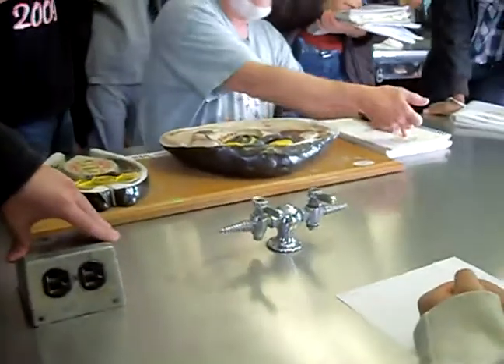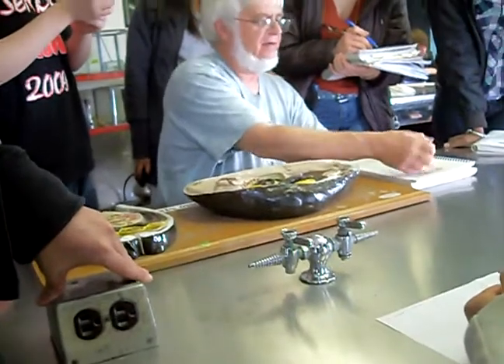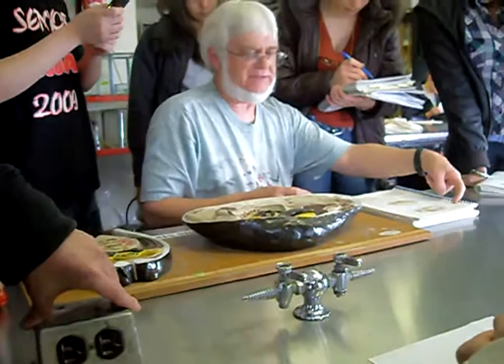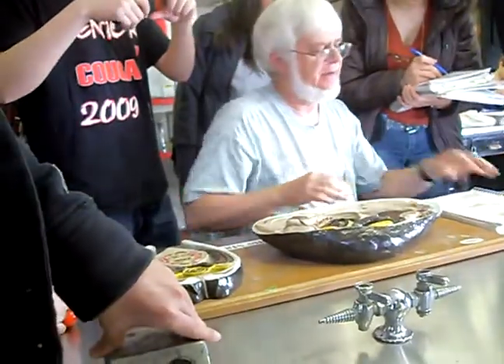In the picture, it's just the other way around. The valve is this way — this is the right valve — and what's been removed is the left valve. So this one, the head end is facing this way, and this one, the head end is facing that way. So everything is reversed from the picture, so that's a little confusing.